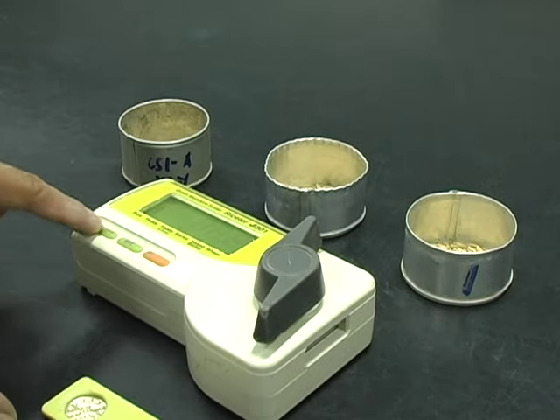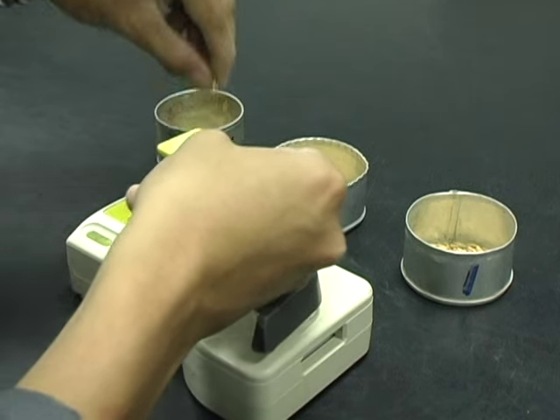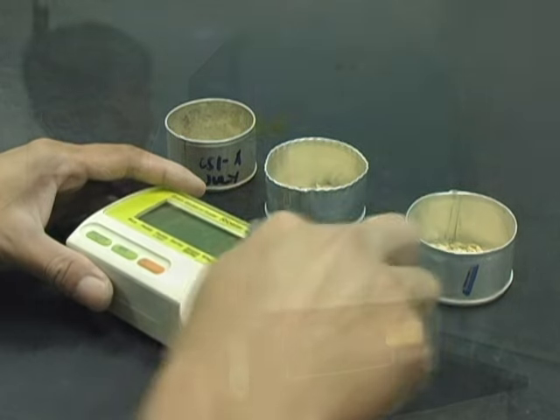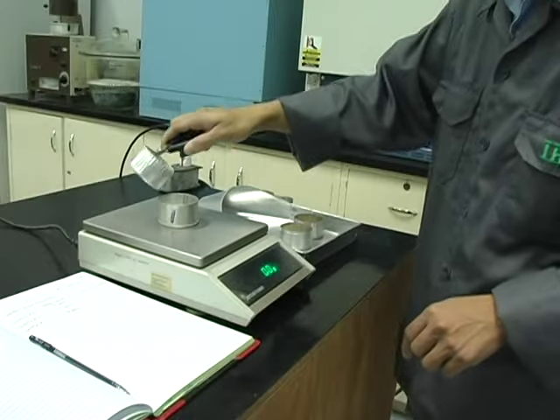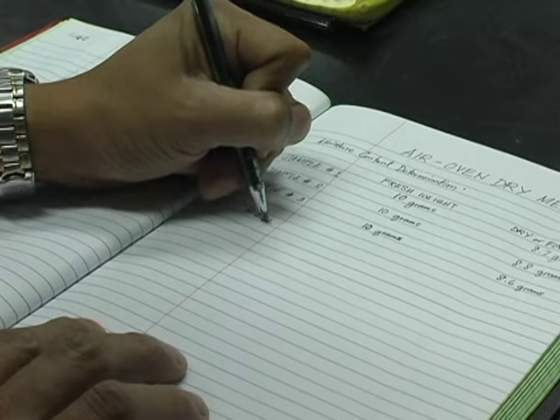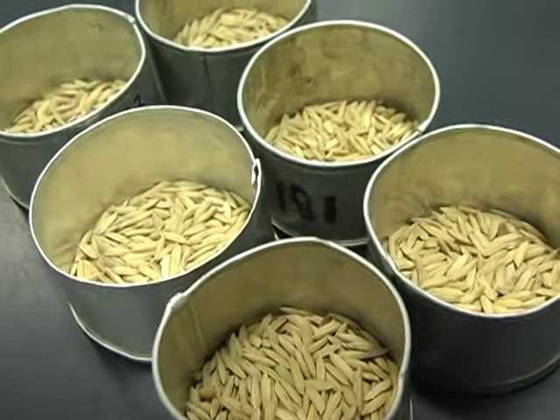Quick moisture testers are most suitable for use in the field and for trade, but be sure the batteries are good before each use. Now, you are ready to accurately measure the moisture content of your grain using a method that suits you best. Remember, accurate testing means better quality rice and paddy.